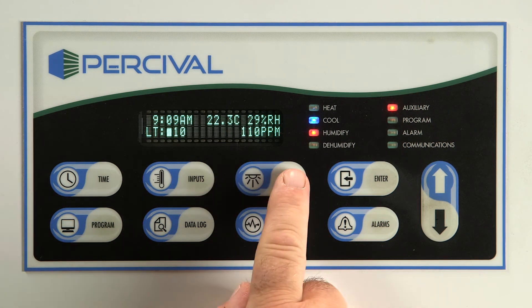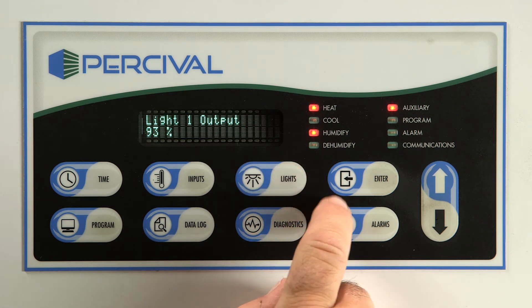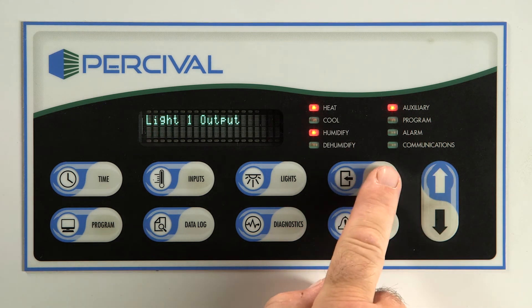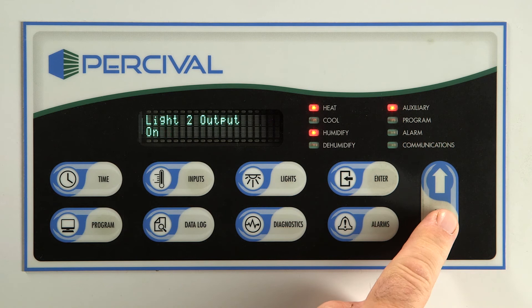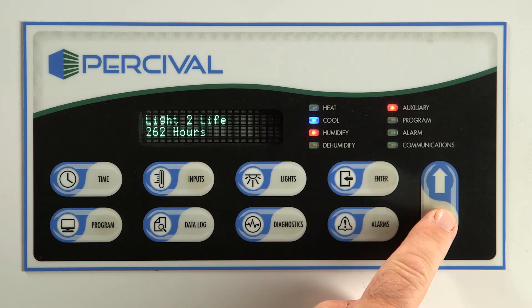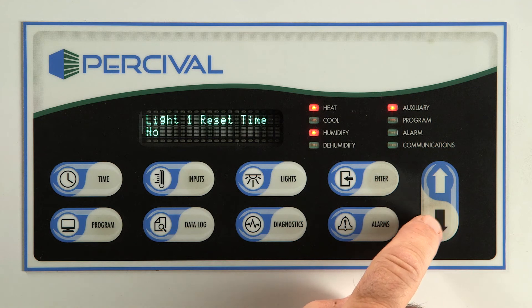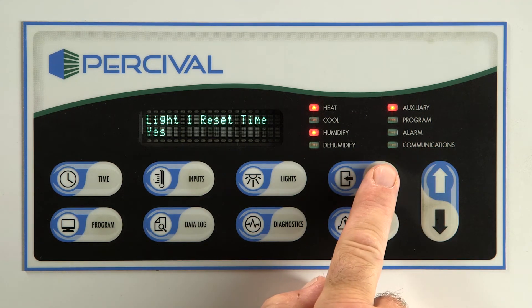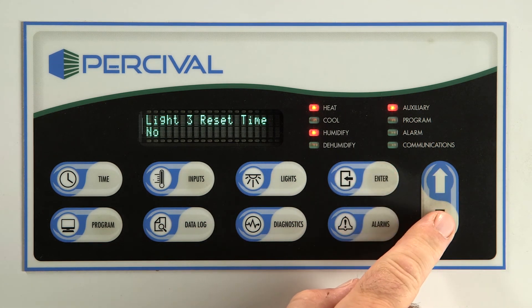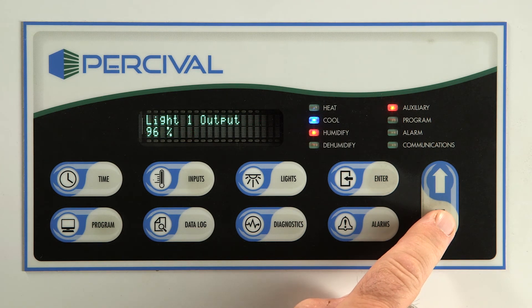The lights key turns lighting events on or off, or allows setting the lighting on a percentage basis if the chamber is equipped with open loop dimming. Remember, enter to change and enter to save. Arrowing down on the light menu reveals a setting for light lifetime showing the number of hours a specific light event has been on, a lifetime alarm that can be changed, and a way to reset the light lifetime. When the number of hours reaches the preset lifetime alarm, the controller will alarm and indicate the lamps should be changed. This alarm is simply a notification and will not turn the chamber off. To silence any alarms, press the up arrow key.